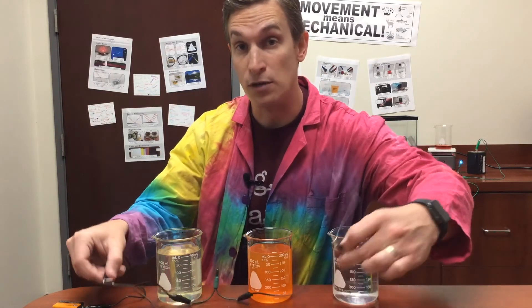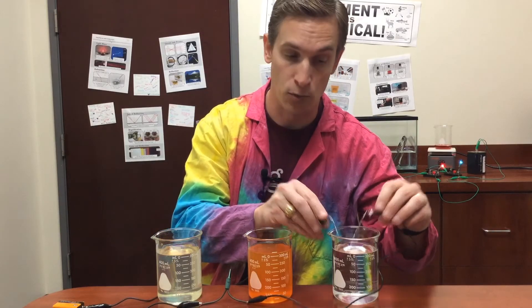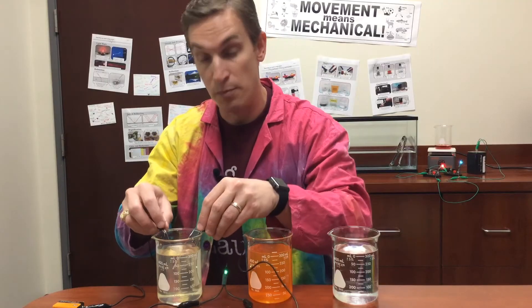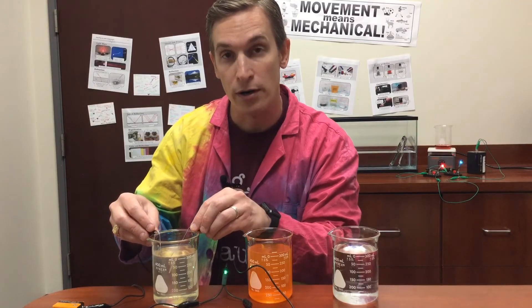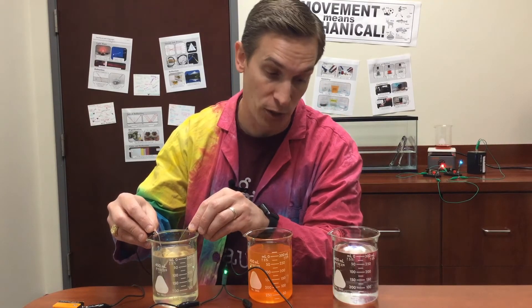Salt water has a property that's different from sugar water — salt water is actually a very good conductor of electricity compared to sugar water. So I can use a conductivity tester to see which of these solutions is a good conductor of electricity. It's not this one, but this one does conduct — so this solution is the salt water, because it's a good conductor of electricity, while the sugar water is not.